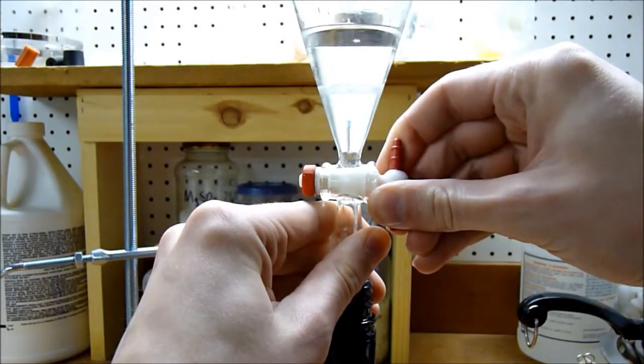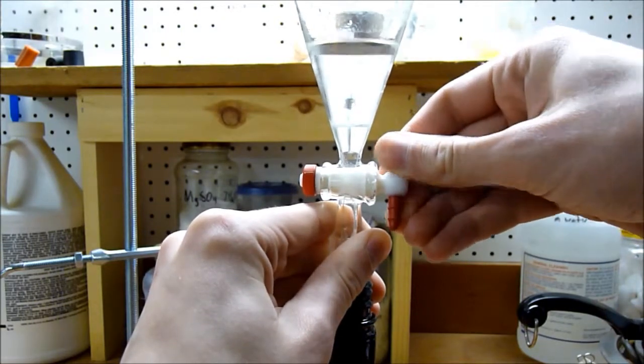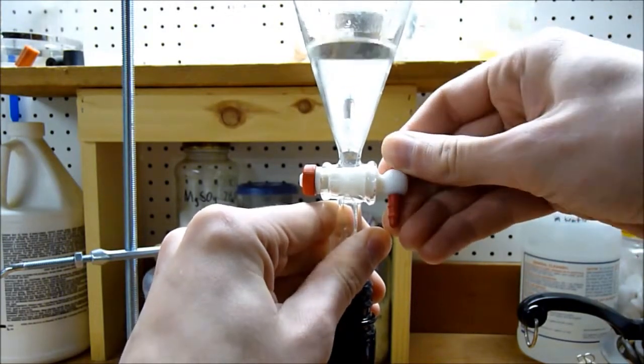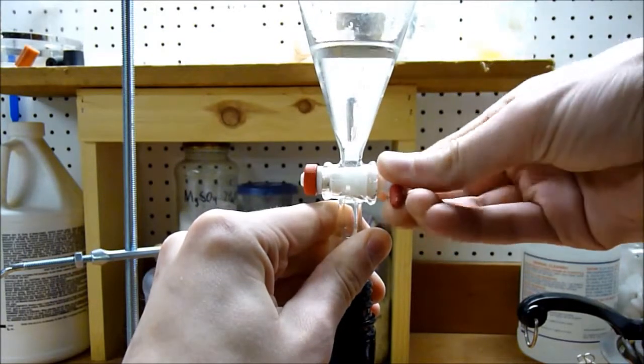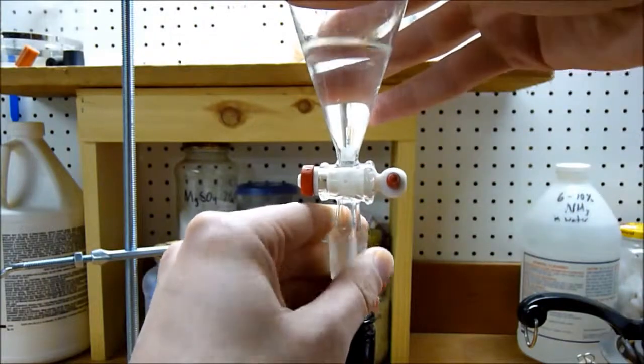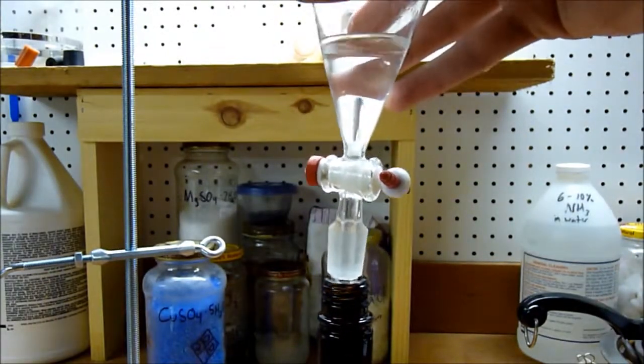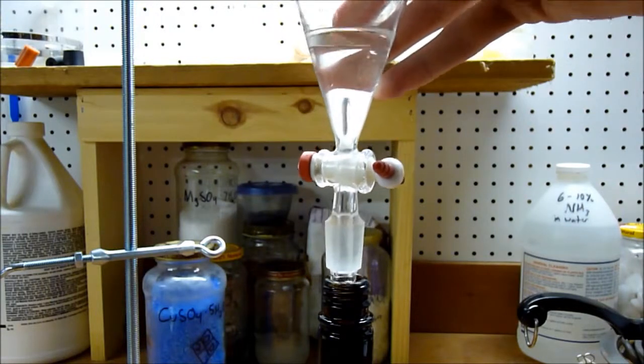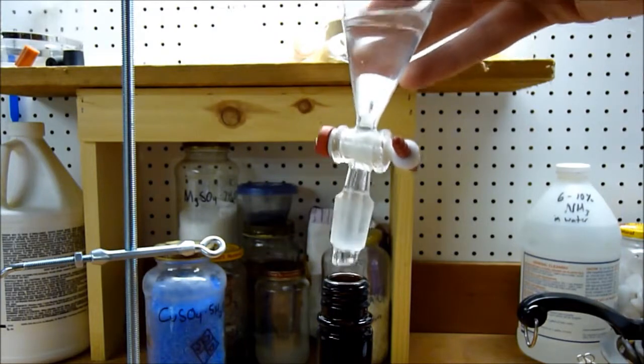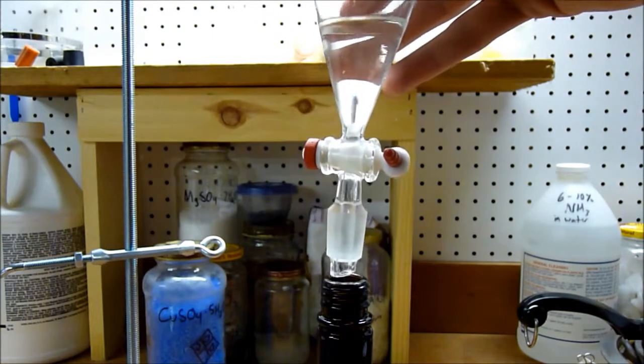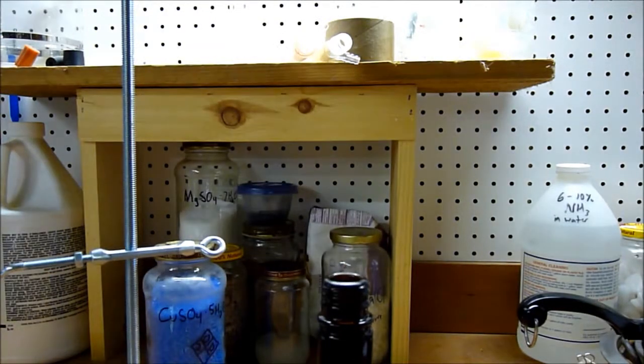Bottom phase is going into the bottle. Slowing it down. Make sure you get every last drop, because this is precious stuff. This can go into the sink now to be washed.